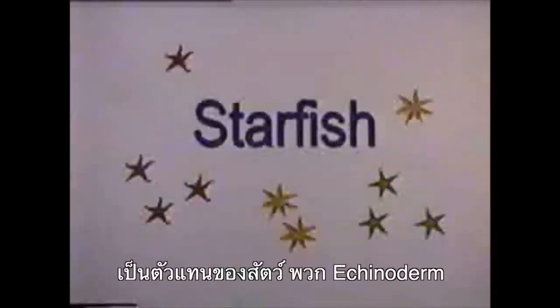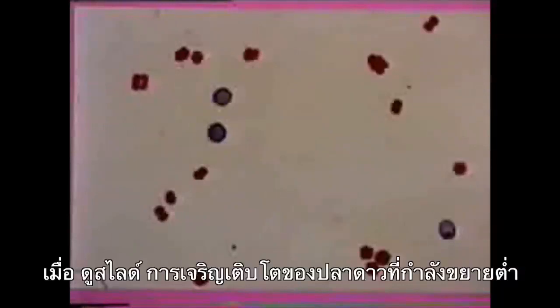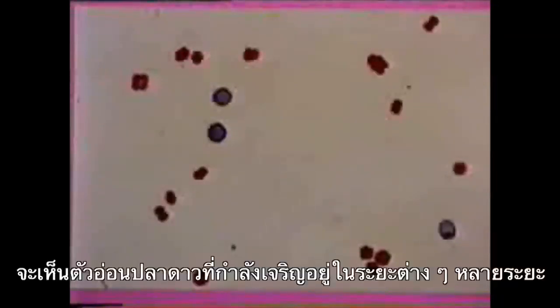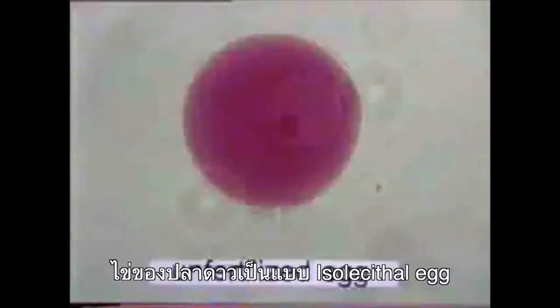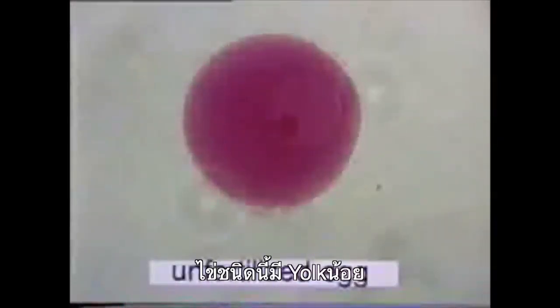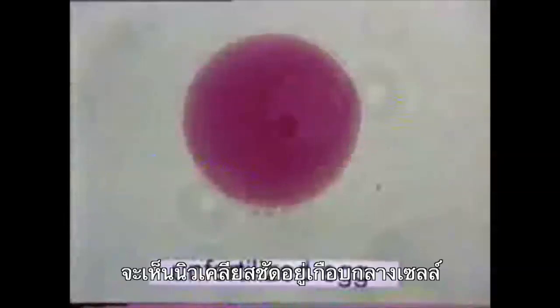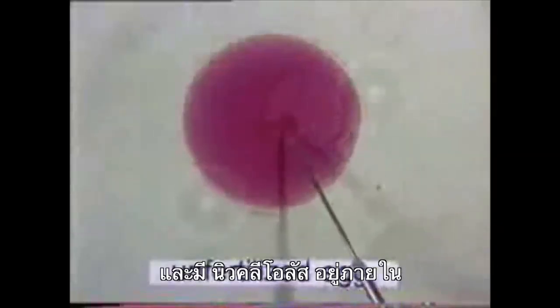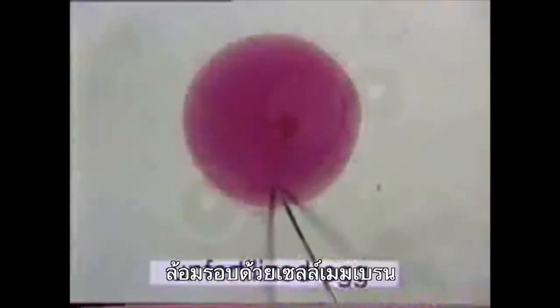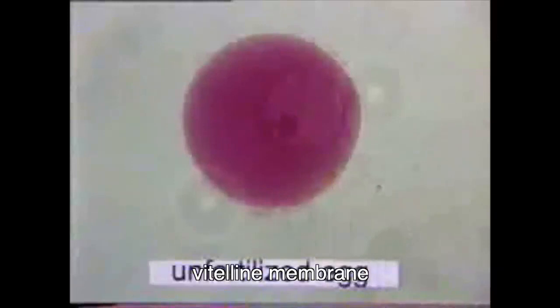Starfish are echinoderms. Here is an image from a microscope under low magnification showing eggs and embryos at various stages of development. Starfish have isolecithal eggs, which contain a very small amount of yolk evenly distributed in the egg cells. In an unfertilized egg, the nucleus is visible and located almost in the middle of the cell. The nucleolus is also visible. The cell has been dyed red. The egg cell has a plasma membrane, and there is a transparent outermost layer called the vitelline membrane.